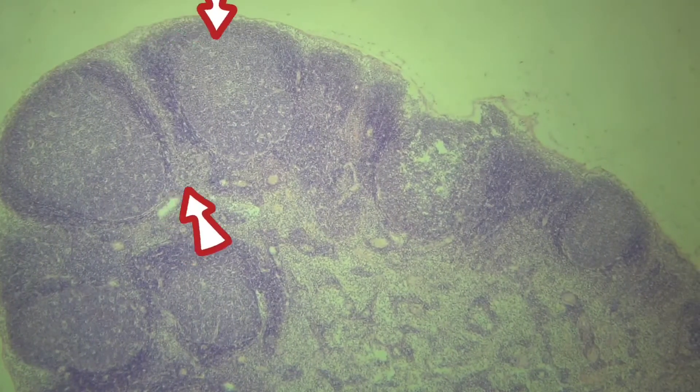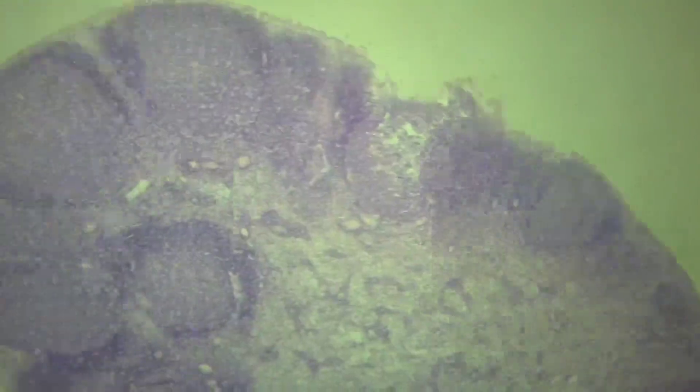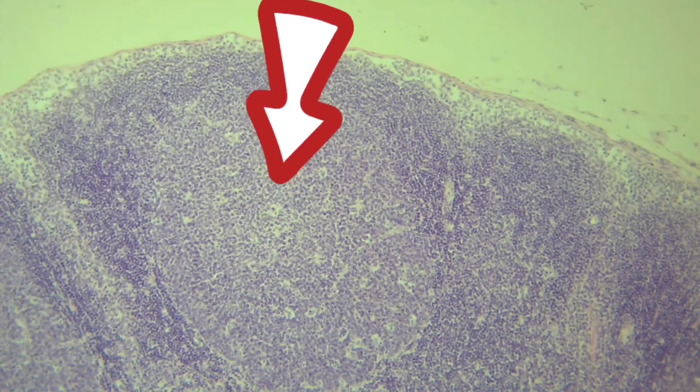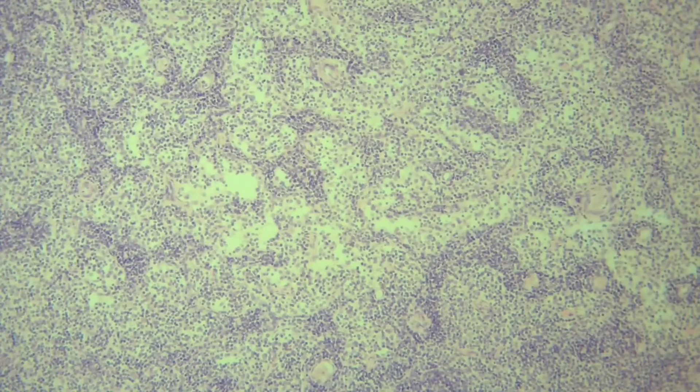The parenchyma of the lymph nodes consists of cortex and medulla. The cortex contains the lymphatic nodules and a deeper component that surrounds the nodules, known as the deep cortex or paracortex. The medulla contains medullary cords.